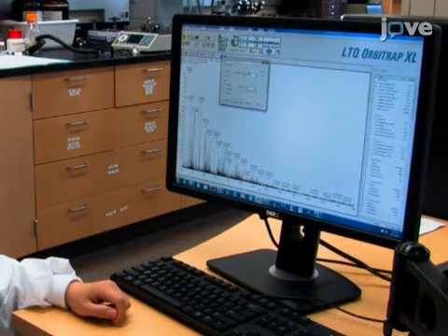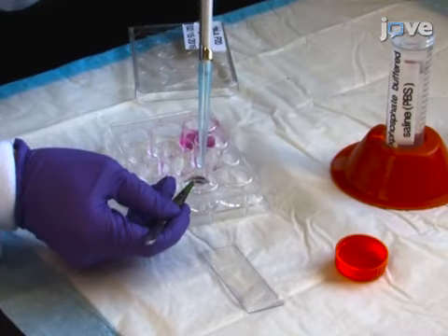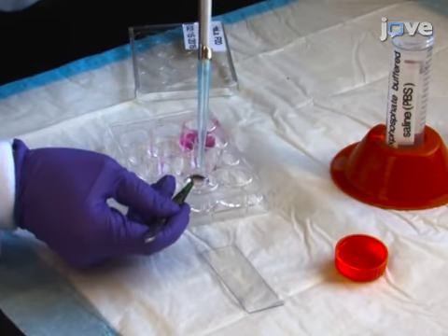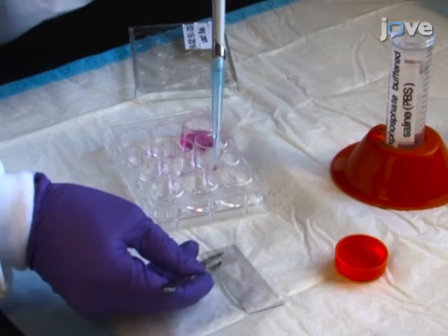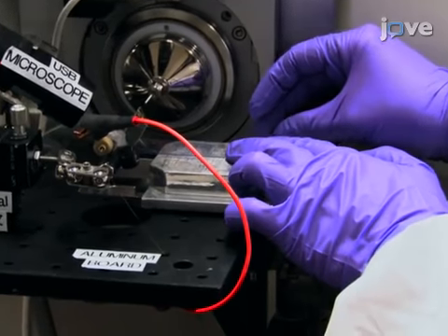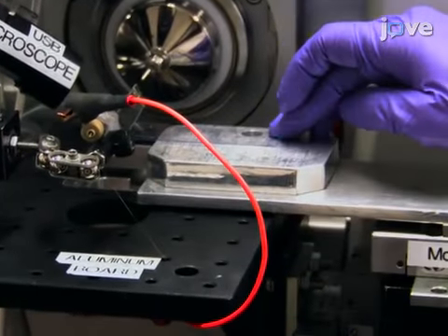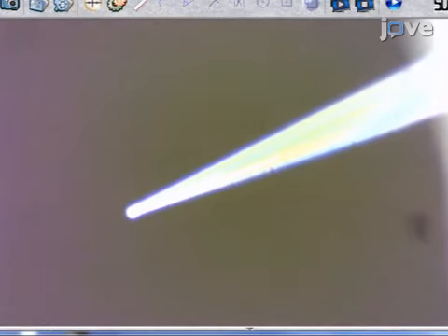Set up the single probe system as per instructions for MSI and adjust the solvent flow rate. Wash the cultured cells attached on the micro-cover glass slides with PBS to remove cultural media and extracellular drug components. Then, place the cell-containing glass slide onto the motorized XYZ translation stage system for the experiment. Focus the digital stereo microscope above the sample onto the tip of the single probe to monitor cell penetration during the analysis.